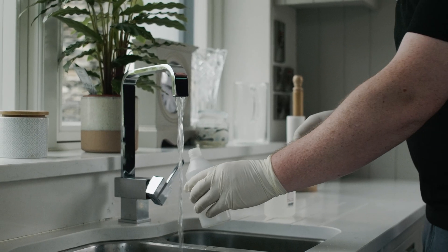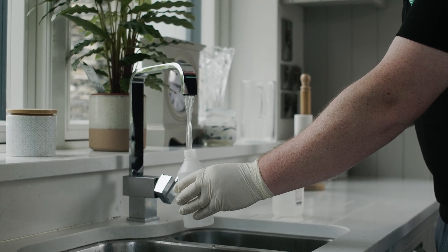Step 5. Proceed to fill the second black cap chemistry bottle and follow the same procedure.